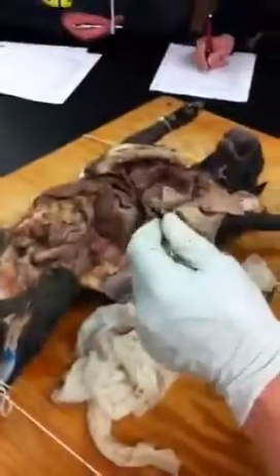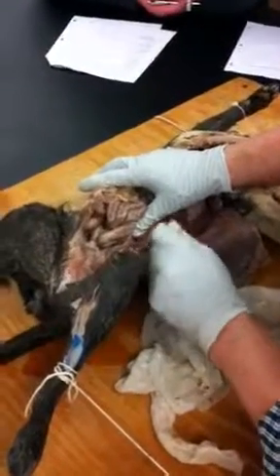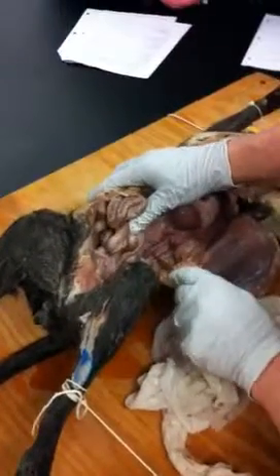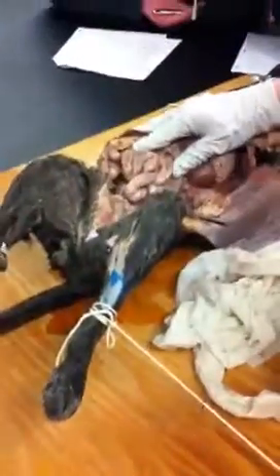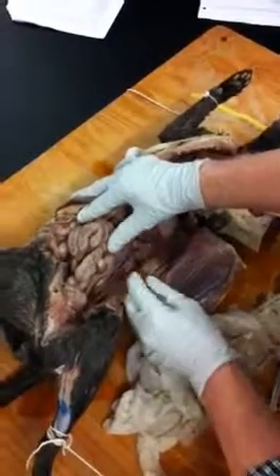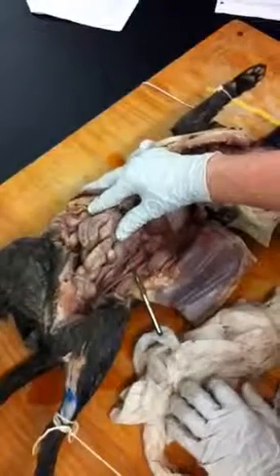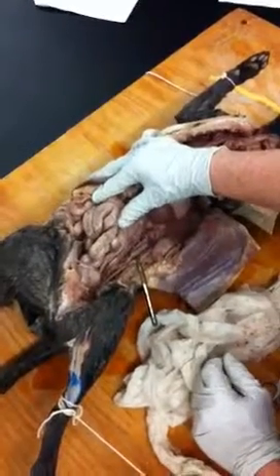Okay, now along the midline of the backbone here, you also have two other large structures, and they run pretty much side by side. So this big blue one, which again is continuous with what we saw here, and the probe is under it there. There's some nerves running over the top of it. That is the inferior vena cava. Okay, and next to it is a large muscular abdominal aorta, which I put the probe under now. This looks thinner, but actually it's only because it's a thick-walled structure.